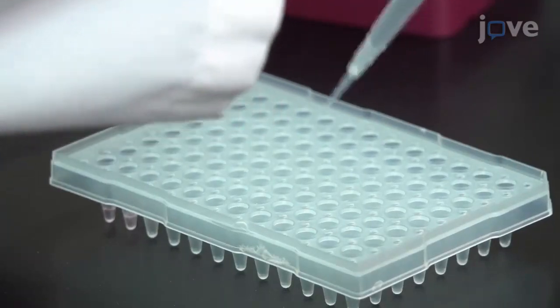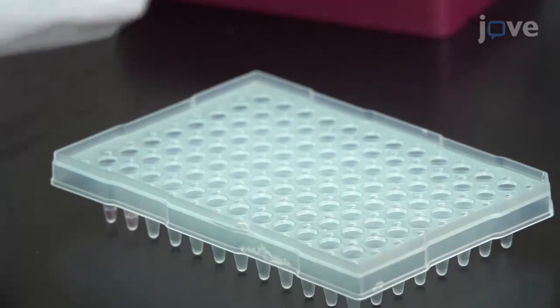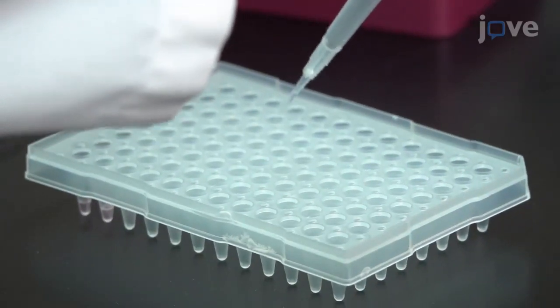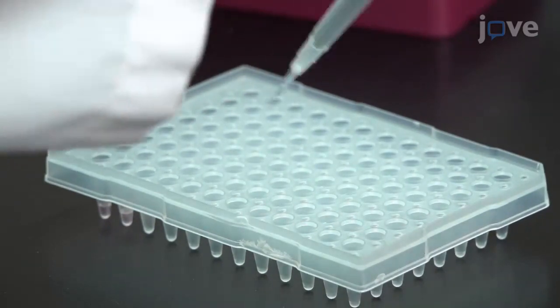Prepare replicate control reactions for digital PCR according to the manufacturer's recommendations. Control reactions for each probe mix must consist of no template controls, negative controls, and positive controls.